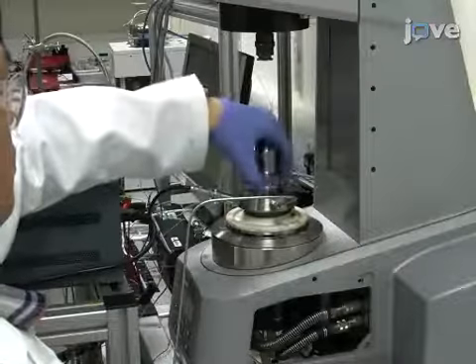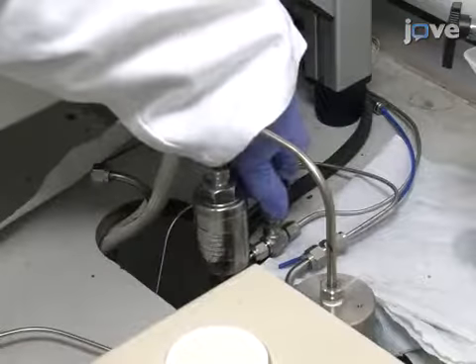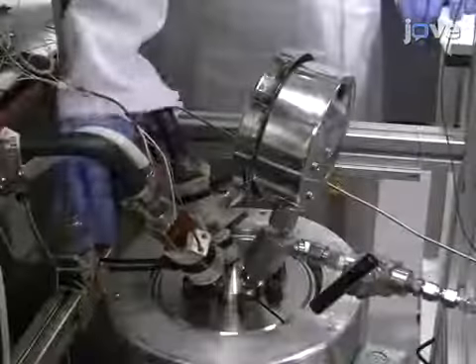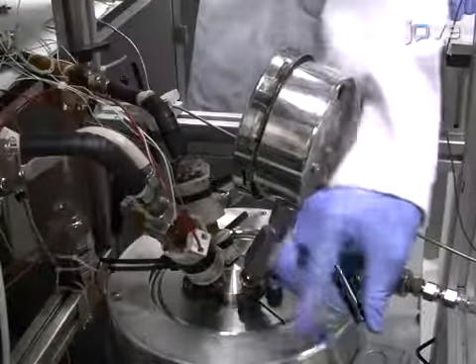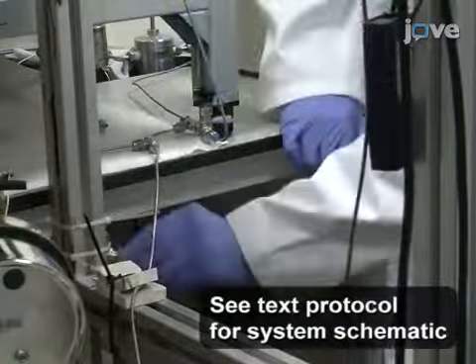Remove the pressure head and measuring cylinder from the pressure cell. Ensure that the valves to the gas tanks are closed. Close the oil and gas valves connected to the mixer, the gas valve to the pressure cell, and the gas relief valve.